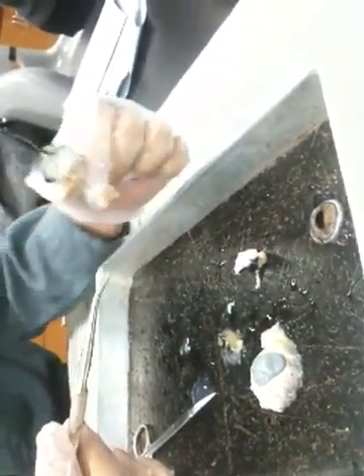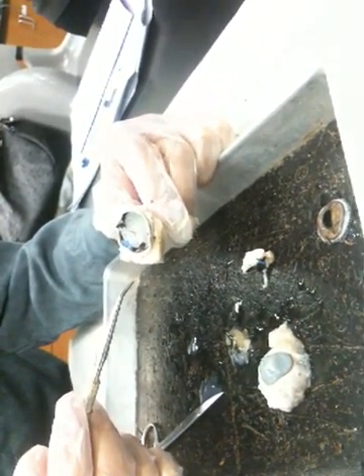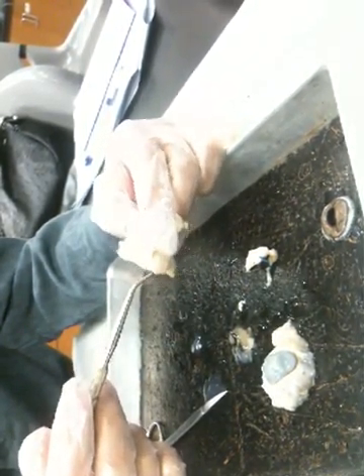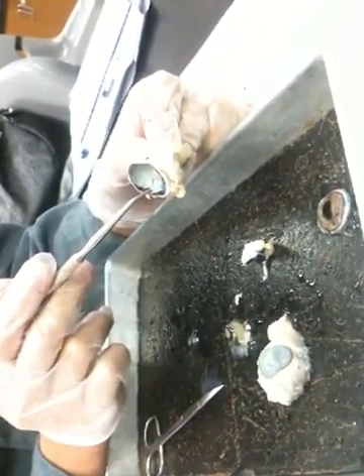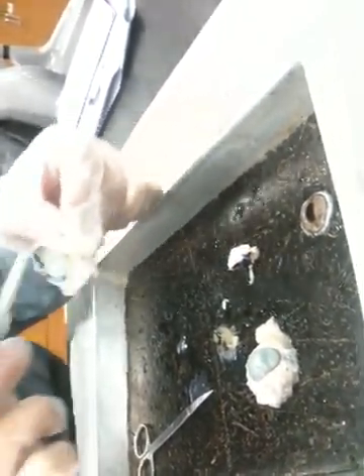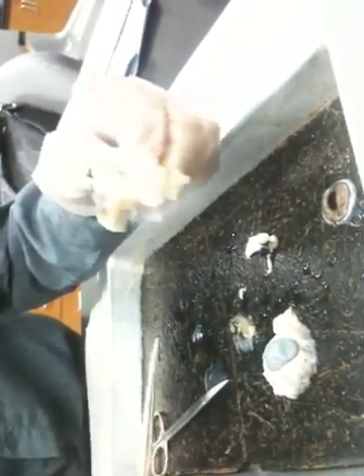You guys see a pucker in the retina? What you can notice is that in the retina there will be a puckering at some point. What do you got there? Right in the center of the disc, the pucker is the disc. That corresponds to the optic disc. That's the blind spot. That's where the optic nerve enters the eye. So if you turn the eye around and kind of keep track of where that spot is, you should see the optic nerve coming right off there, and we do. The optic nerve is right out there, exterior to that same portion. So the optic disc would be noted basically as just a pucker in the retina.